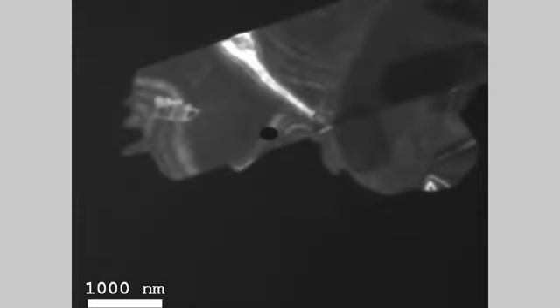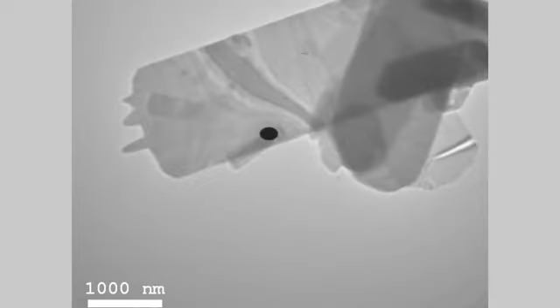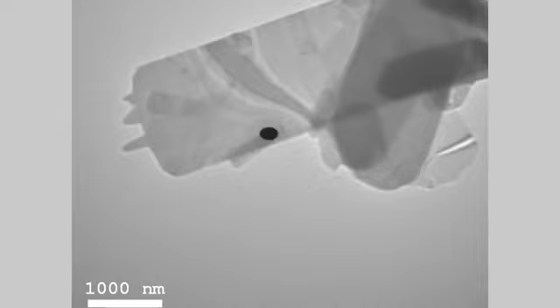So this is the dark field image. Here the white represents those electrons that were diffracted into that little aperture slot that we selected. Here is the standard bright field image again. I told you that the contrast in the image could be enhanced by putting in the objective aperture. We can try that. You see? The black things become more black. That means that the electrons that were deflected in the sample have now been filtered completely away, and they never hit the fluorescent screen. You can increase or reduce this effect by choosing different sizes of the aperture. And then we're back at the beginning.